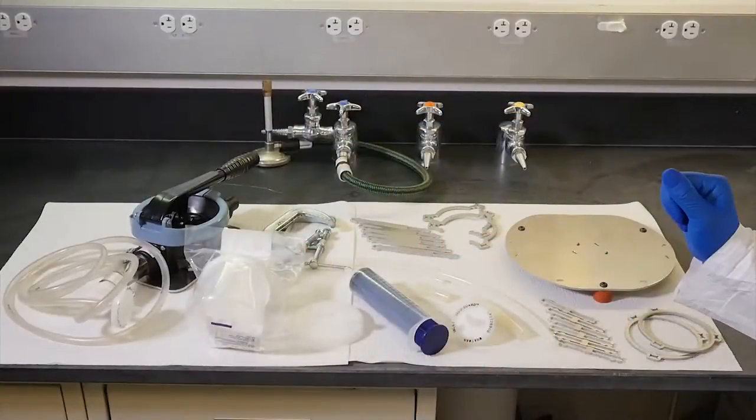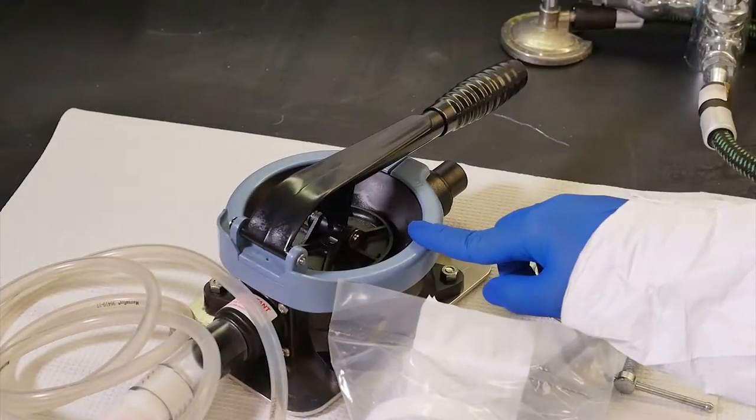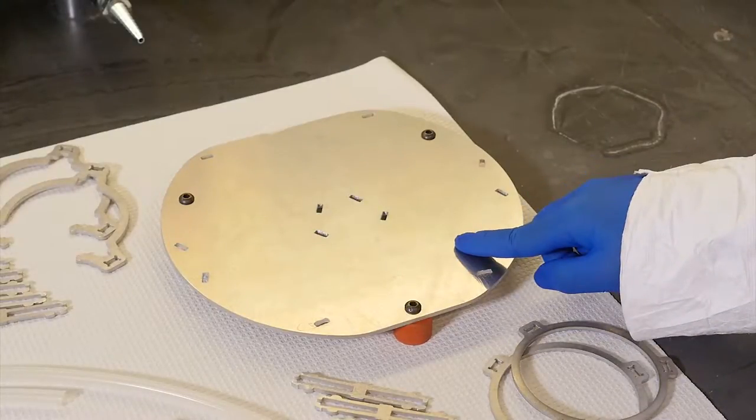The elution device contains a variety of pieces, including a bilge pump for driving elution, a base plate for holding the filter stand and collection cup stand.